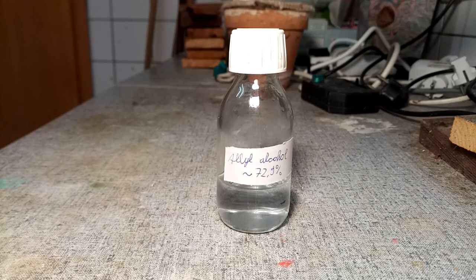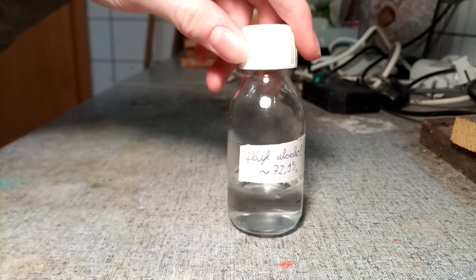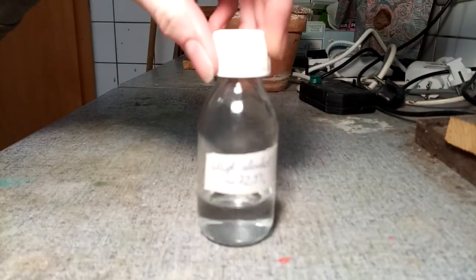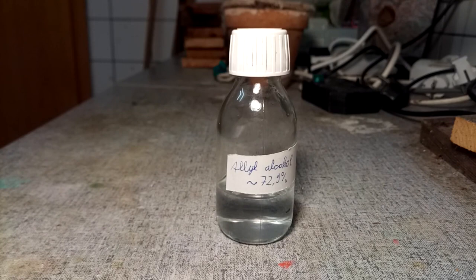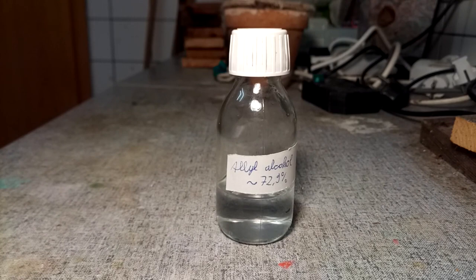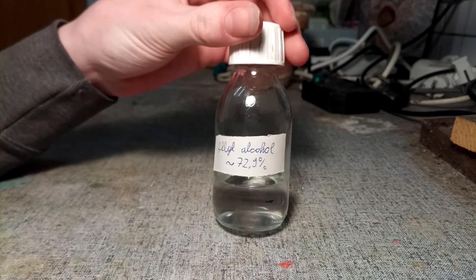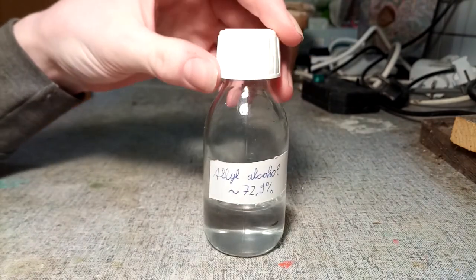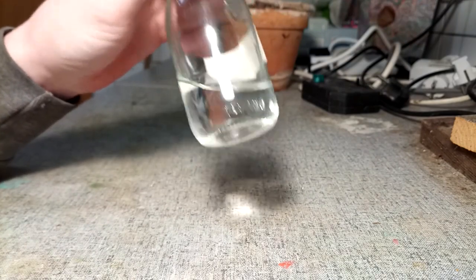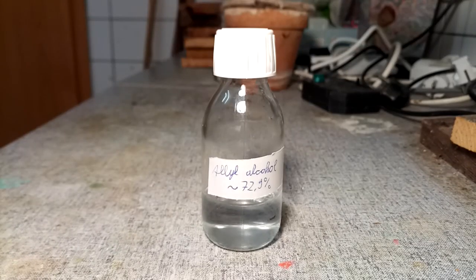Here is what I collected. This is what came over up to about 83°C, which is a bit odd because the azeotrope of allyl alcohol should boil at around 87-88°C. The azeotrope should be at 72.9% concentration, which this is probably about 70%. I let this go until I saw some optical distortions from the drops of distillate hitting the liquid, indicating the refractive index changed, and at that point it was coming over very dilute.